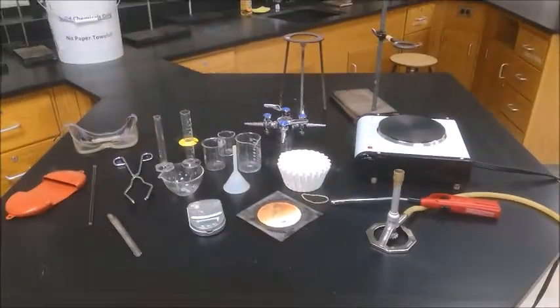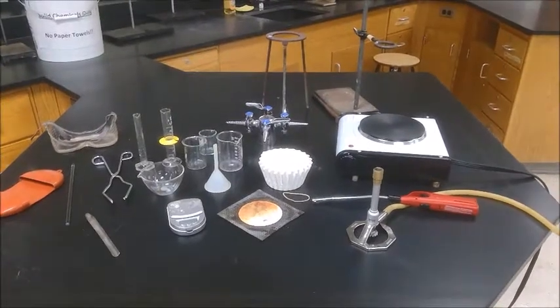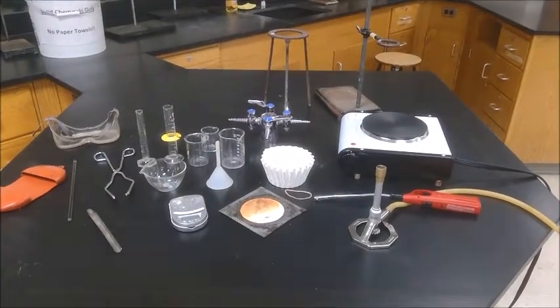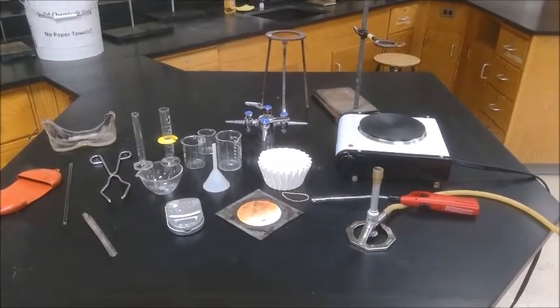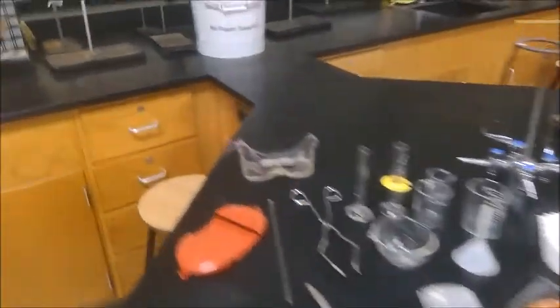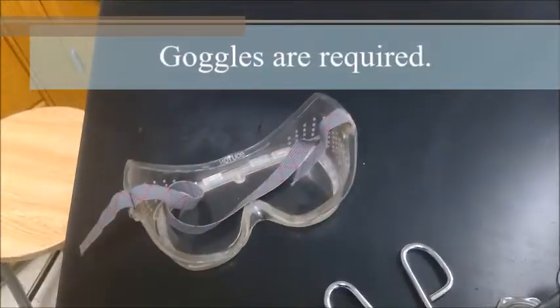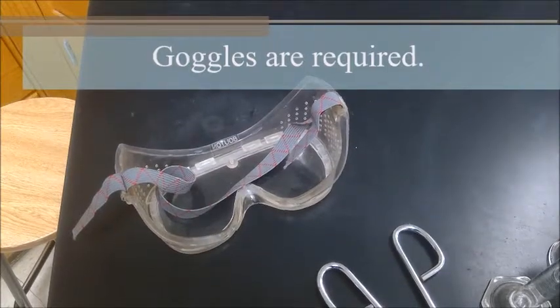Regardless of what you decide to do with your procedure, you're going to be working with glassware, chemicals, and hot stuff. So as is always the case, make sure that you put your goggles on throughout this lab.